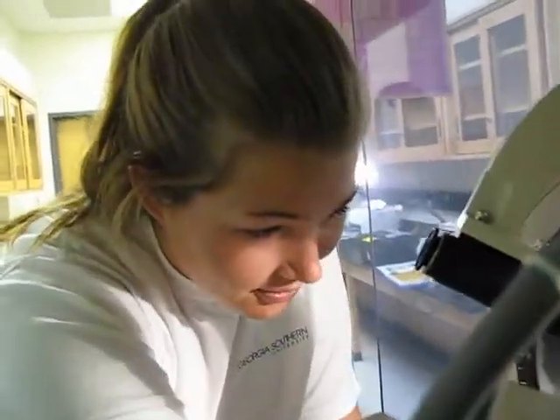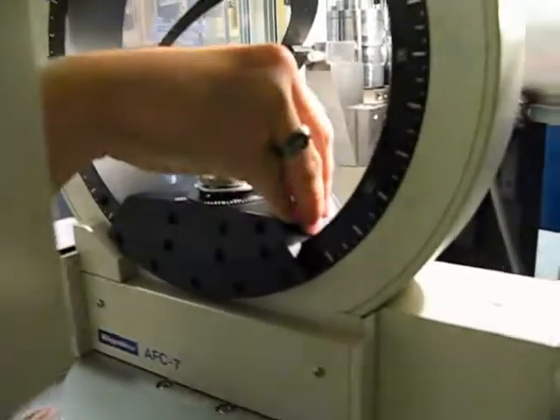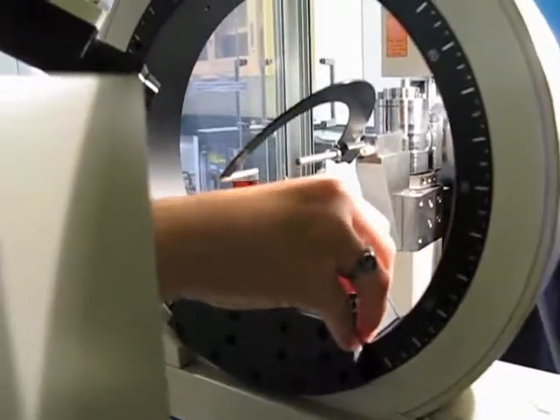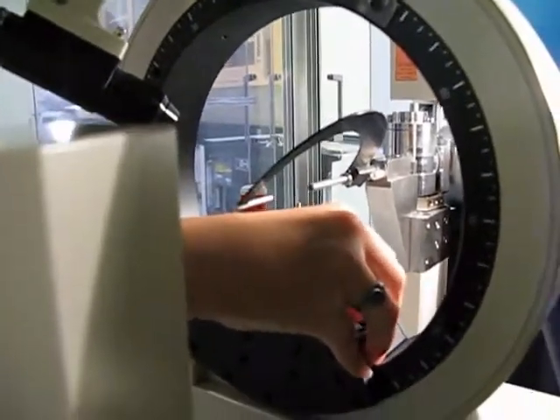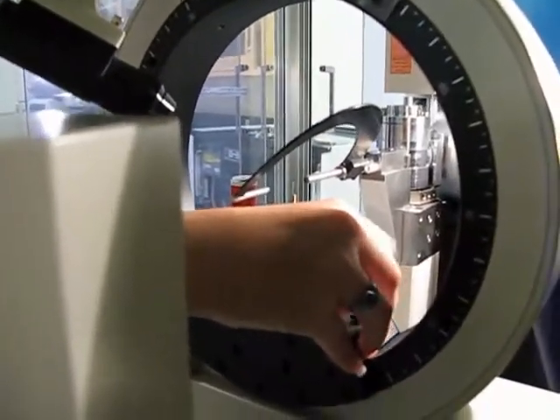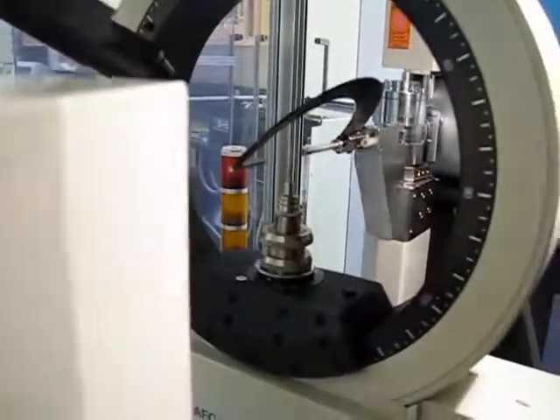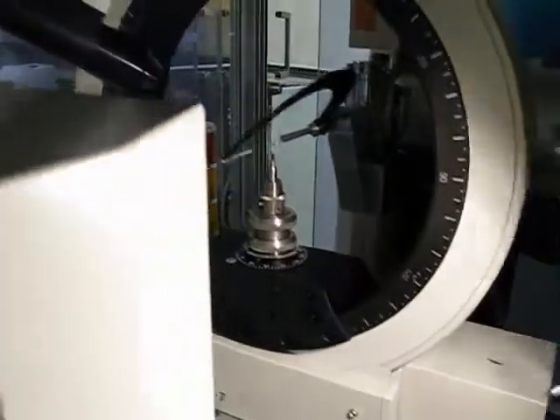There are tunnels within the thumb screw that will lead to other parts of this machine. I believe so. There we go — okay. Port B. Yeah, screwing in stuff without lube is hard to do.